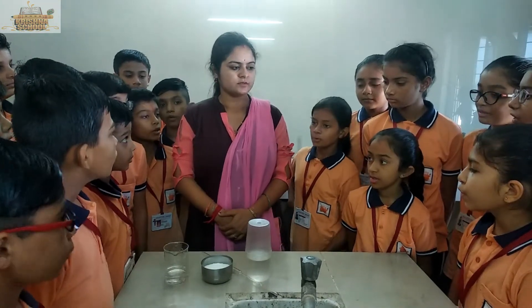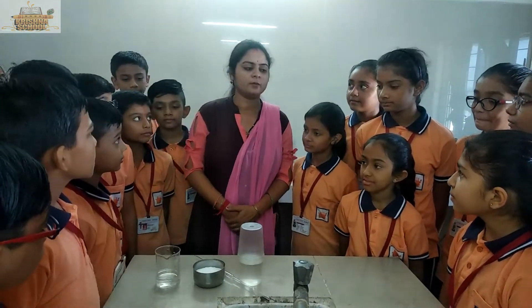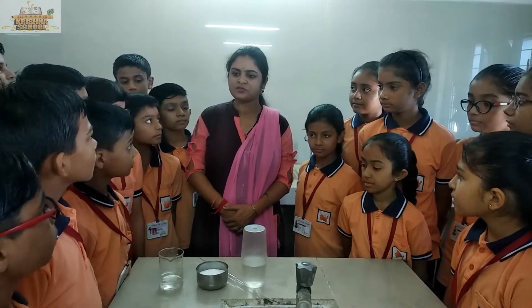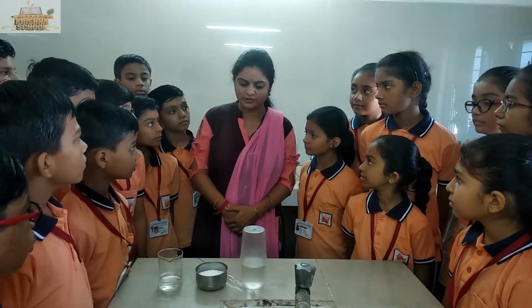Good morning students. So today we will perform a practical related to saturated and unsaturated solution.